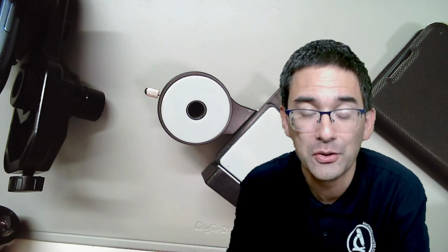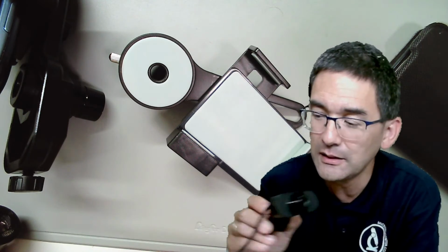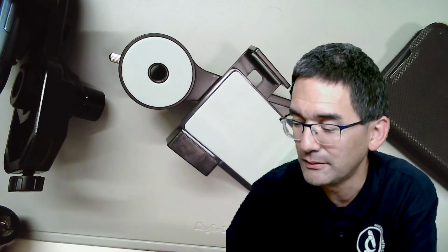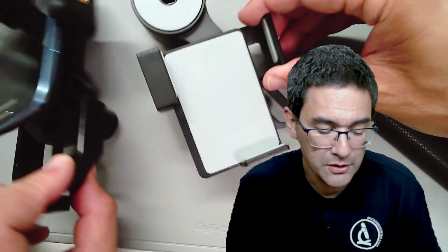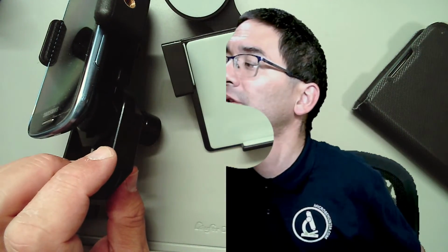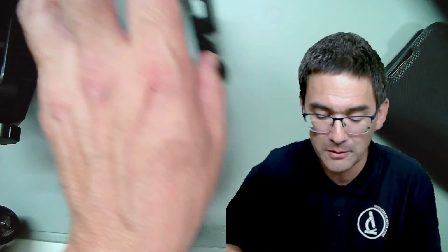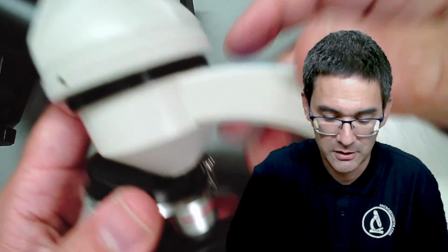Okay, which is also quite convenient because you have those adapters, and of course you can also try to connect webcams directly to the eyepiece, but you don't have an adapter for this. So this is basically, I would say, if you have a mobile phone already, the cheapest solution. And I just want to show you this other microscope over here. Hoppala, I just dropped something. It's a little bit small here.